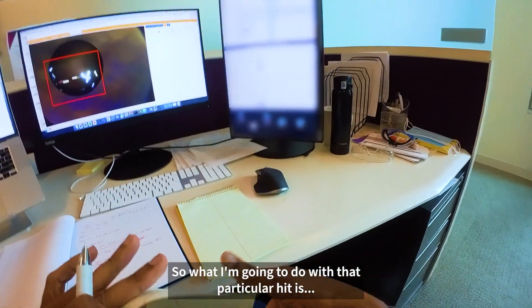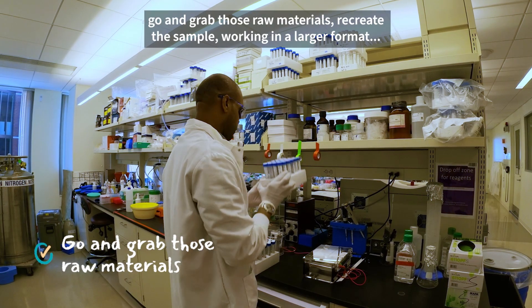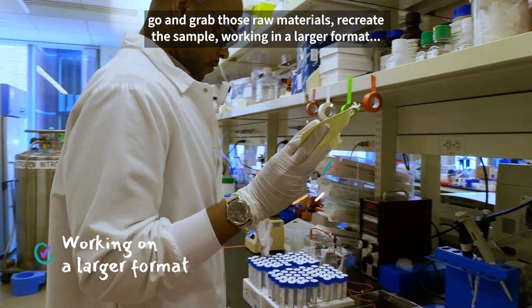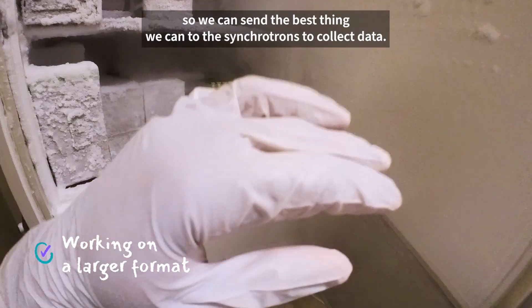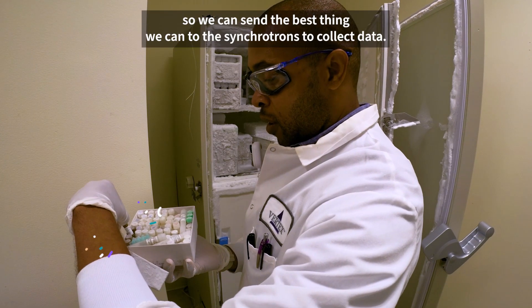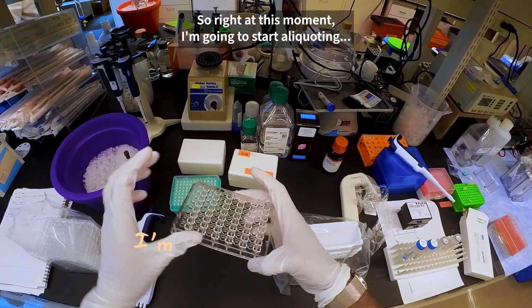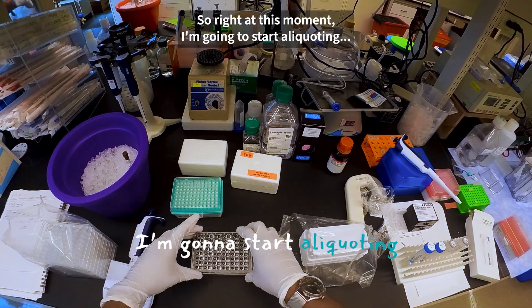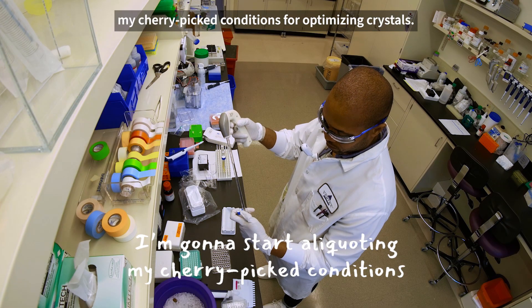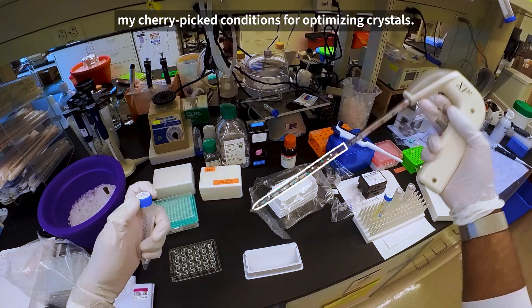What I'm going to do with that particular hit is go and grab those raw materials, recreate the sample working in a larger format so we can send the best thing we can to the synchrotrons to collect data. Right at this moment I'm going to start aliquoting my cherry-picked conditions for optimizing crystals.